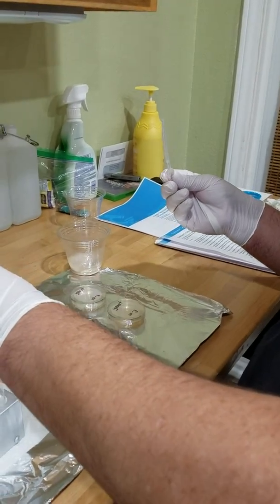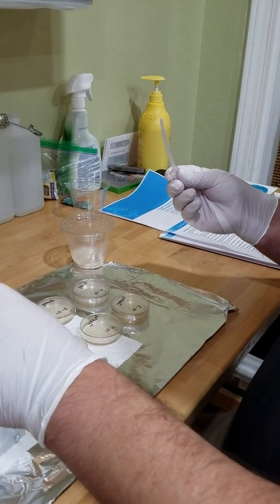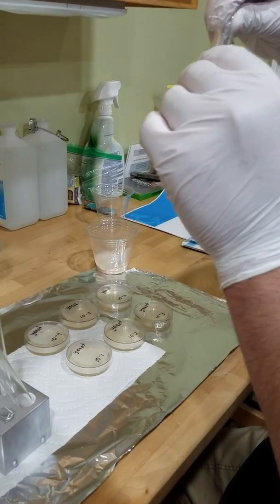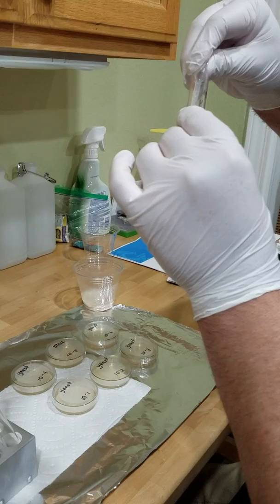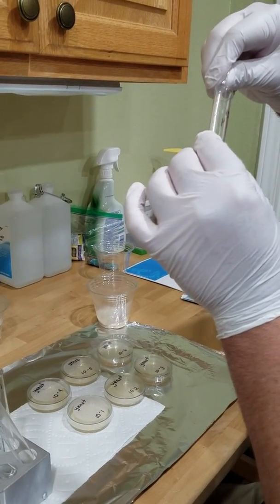Let's put you in a 4. Okay, that's everything out of there.